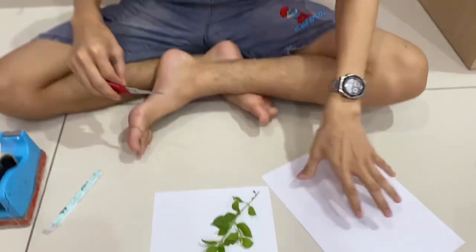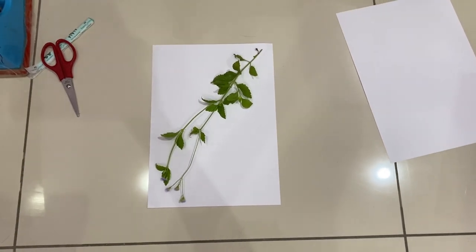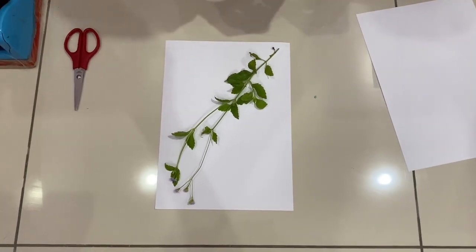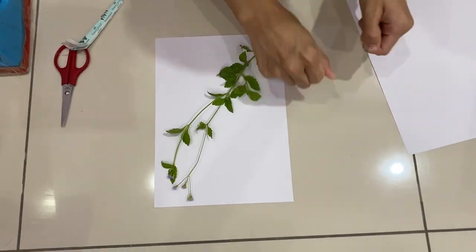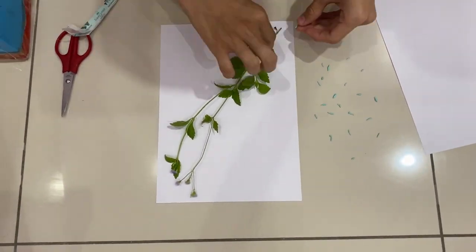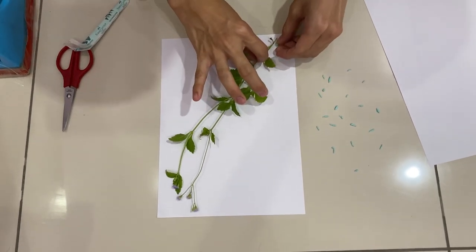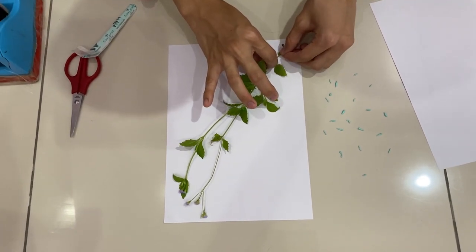These are the books. And the last key part of the compression is the plasticine. Why is plasticine important? It is important to secure the plants on the papers so that it won't be messy after the compression. I will start by making small granules of plasticine, then secure the plant on the paper in the position I want. I'll start with the stem first because most of the mass of the plant is focused on the stems.